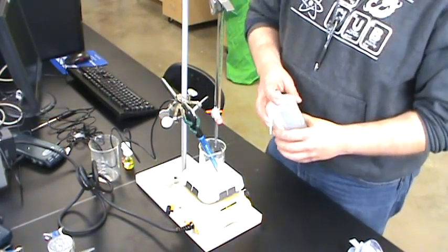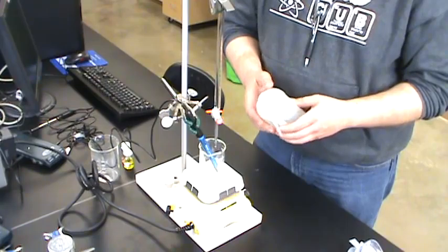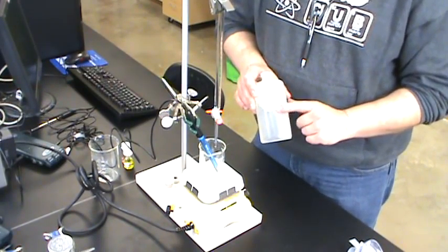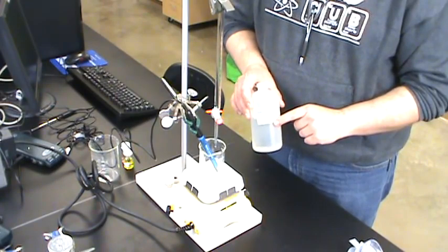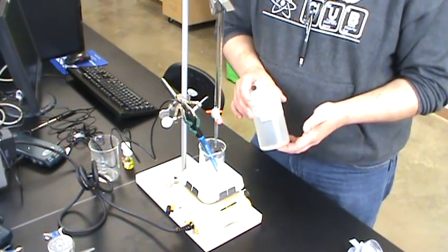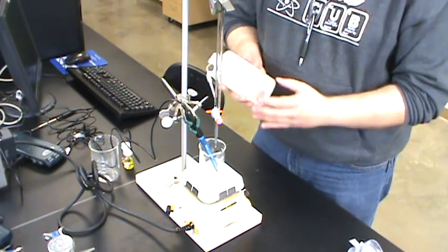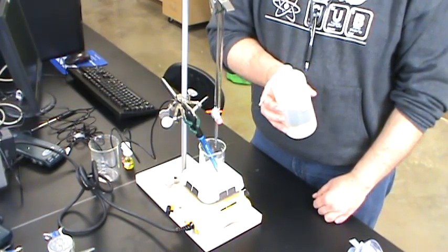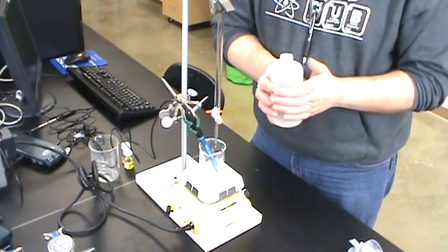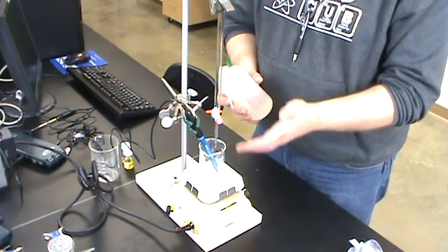This experiment is very sensitive to the water you use. I just pulled this bottle out of a drawer and it's labeled DIH2O — that should be deionized water — but I have no idea who filled it or how long it's been sitting there. If I were doing this experiment, I would almost always dump any wash bottle out, give it a rinse with deionized water, and refill it myself so I know what's in there is good, fresh deionized water that won't cause trouble in my experiment.